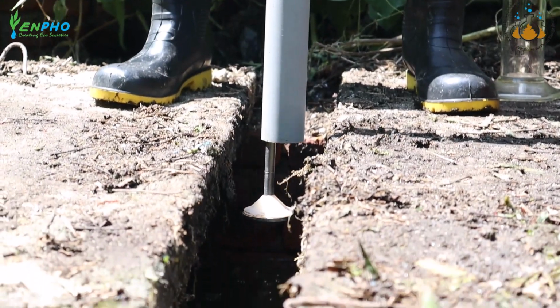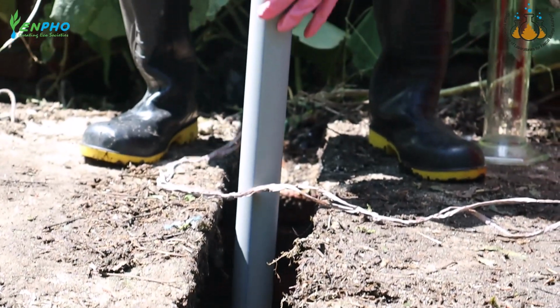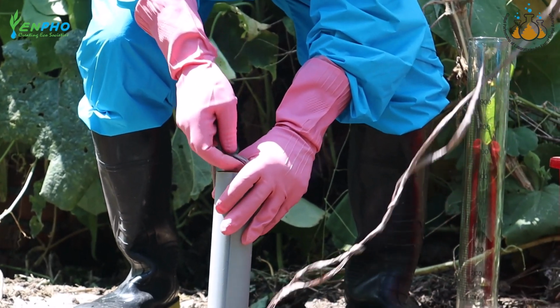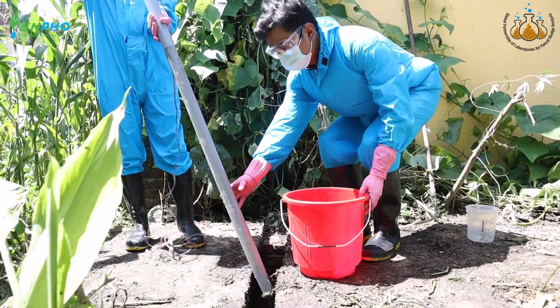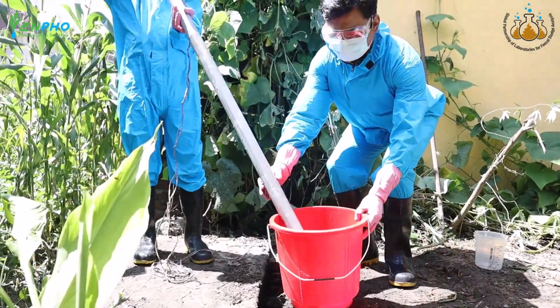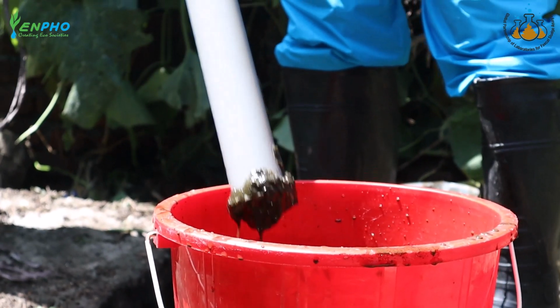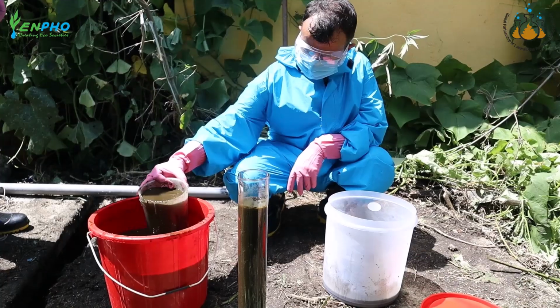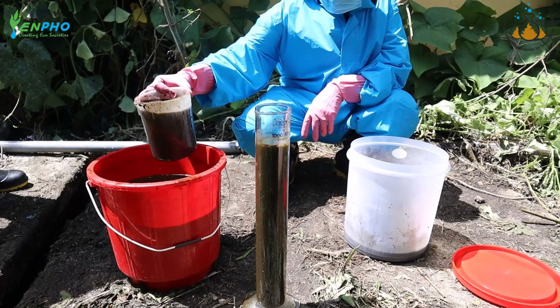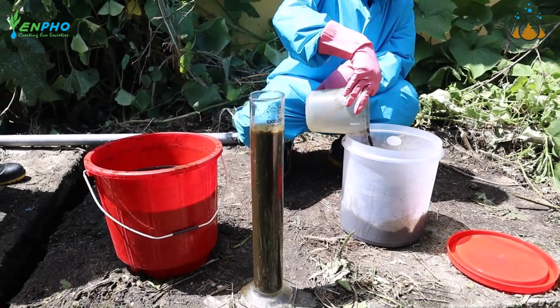The researcher carefully lowers the core sampler through the manhole until it reaches the bottom of the containment. After letting it settle for about 30 seconds, the sampler is sealed and brought back up. The sludge collected inside the sampler is transferred into a bucket. This process is repeated several times until the bucket is full. After collection, the researcher homogenizes the sludge sample by mixing it thoroughly and transfers the sample into a 10-liter container.